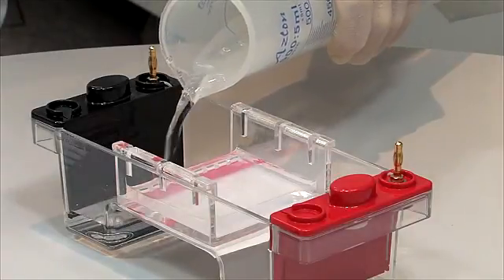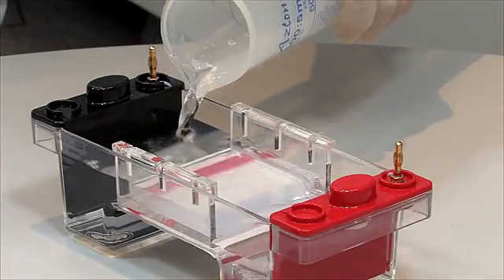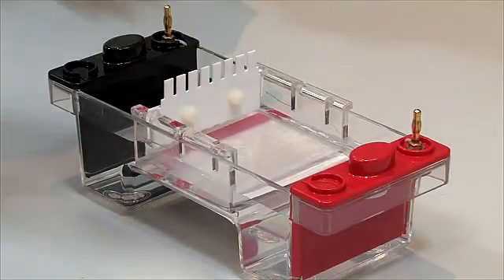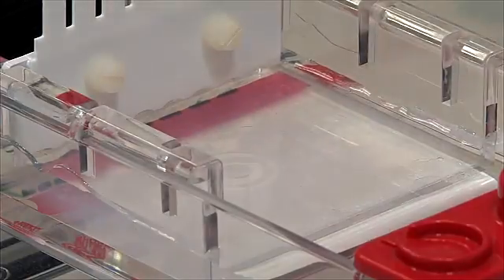Pour just enough buffer to cover the gel and fill the wells. Each comb may be turned upside down and reinserted into the tray to provide a convenient loading template.